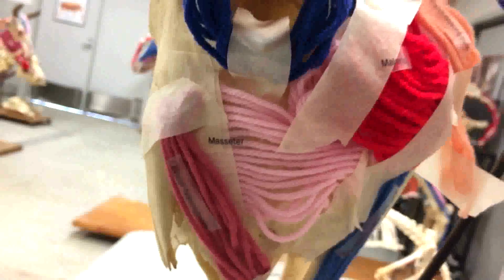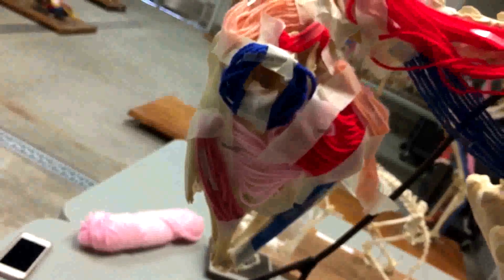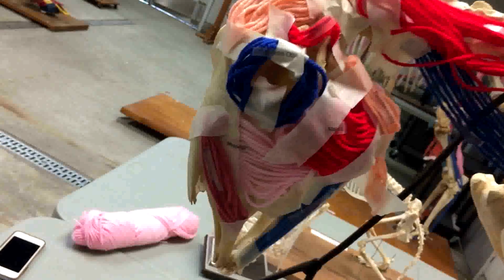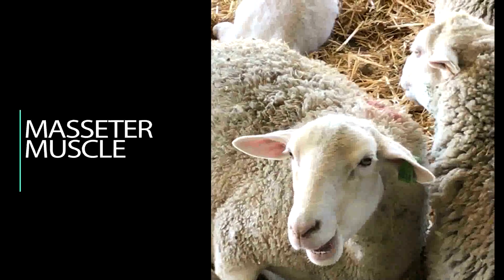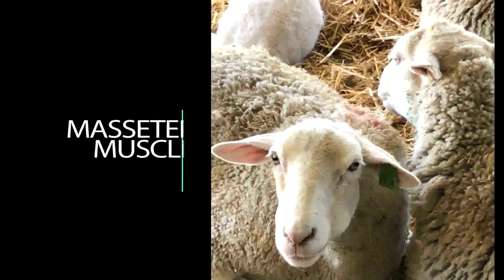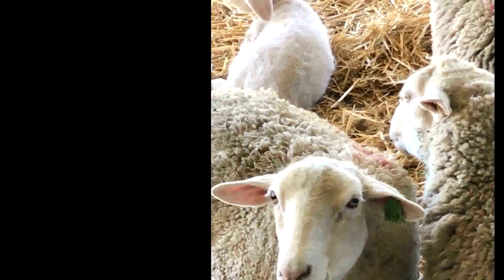The masseter muscle originates from the maxillary region of the sheep's skull. It causes unilateral and bilateral contraction due to the several divisions it makes up. The large masseter in sheep helps support a ruminant diet of mostly plant material that must be masticated multiple times to extract the most nutrients as possible.